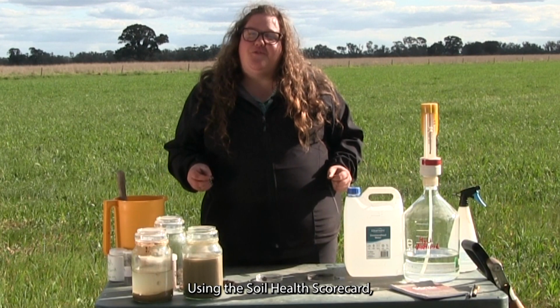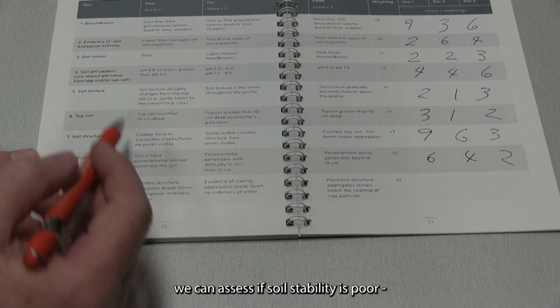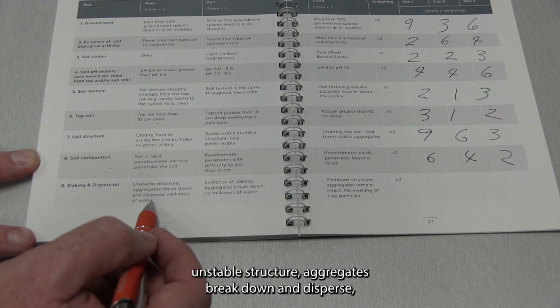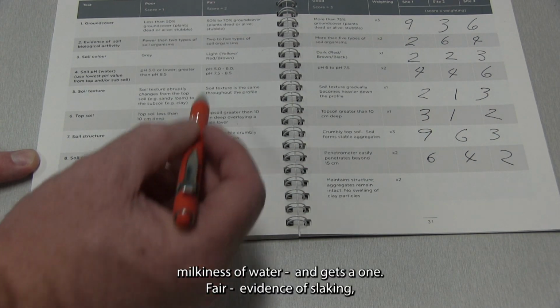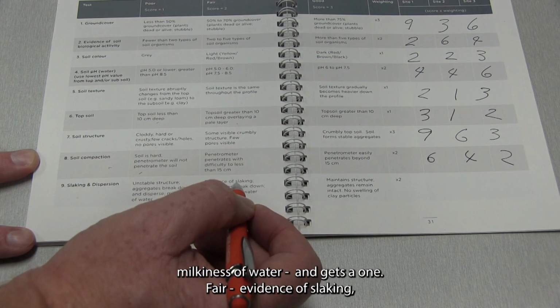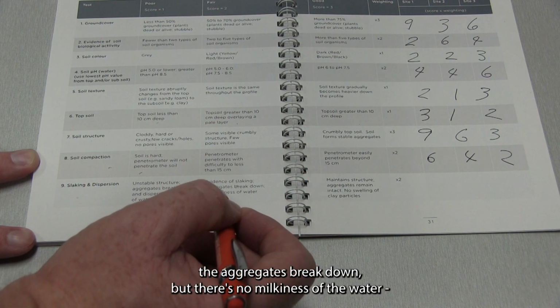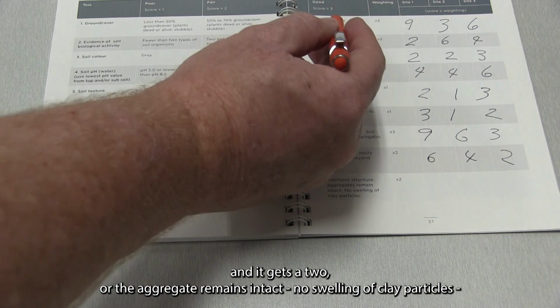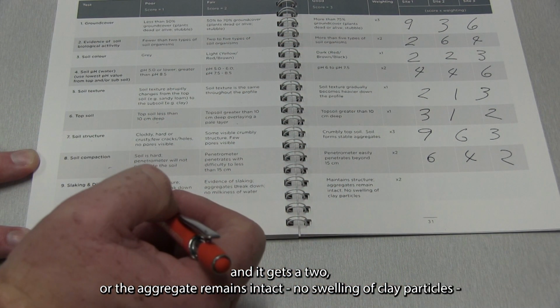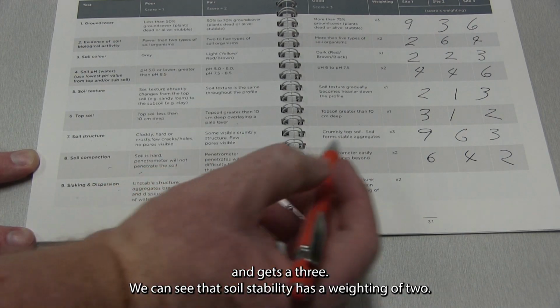Using the Soil Health Scorecard, we can assess if soil stability is poor: unstable structure, aggregates break down and disperse, milkiness of water, and gets a 1. Fair: evidence of slaking, the aggregates break down but there's no milkiness of the water, and it gets a 2. Or the aggregate remains intact, no swelling of clay particles, and gets a 3.